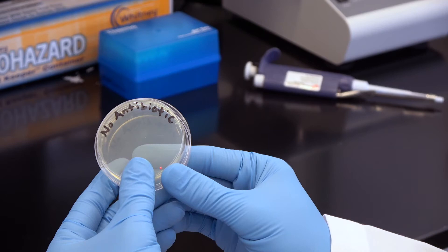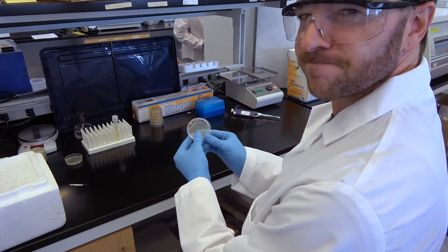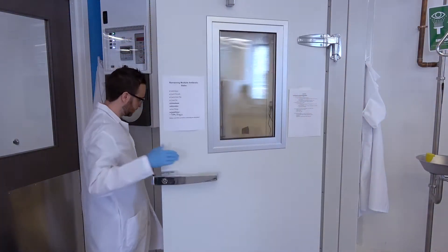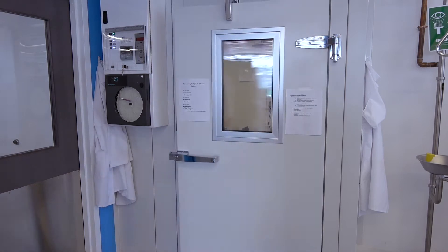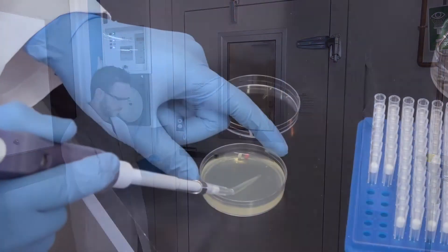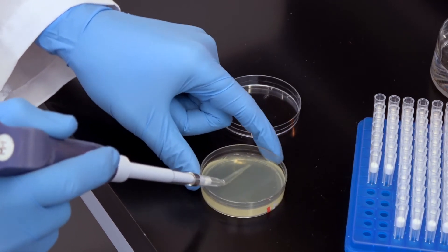When you're busy in the lab, you don't always have time to make new LB agar plates containing every antibiotic you need. Luckily, there is a relatively quick way to add antibiotic to your plates in a pinch. In this video, we'll walk you through the over-agar antibiotic plating method for selection of transformed E. coli.